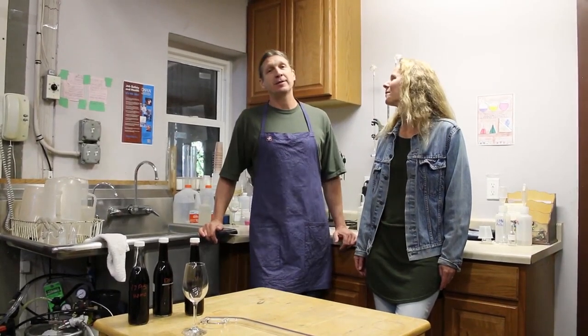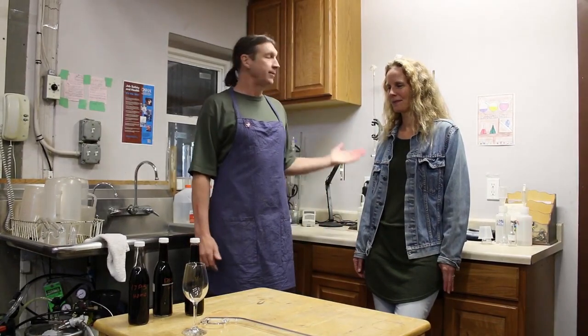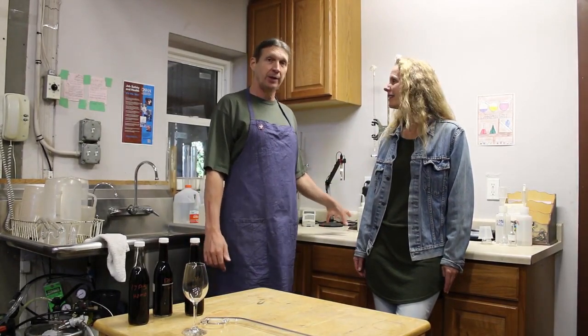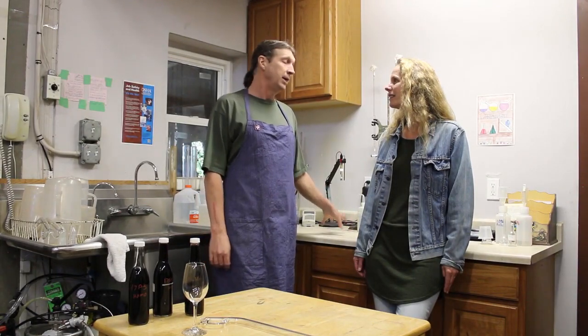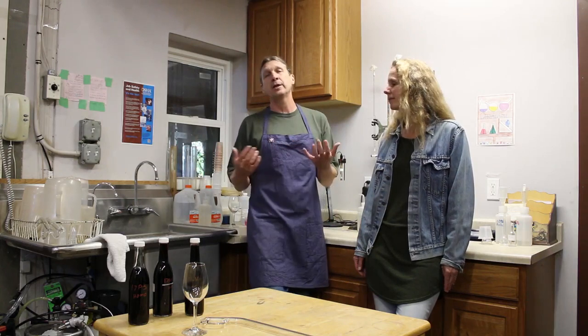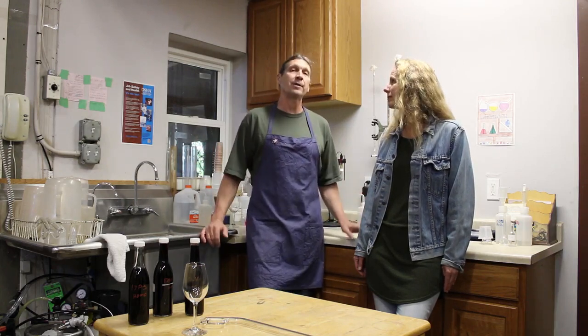Let's go then. Hi, welcome to our lab. This is where we do all of our analyses. So today we were going to walk you through taking pH and TA of our wine. TA stands for titratable acidity. So that would basically be looking at the measure of acid in our wines.